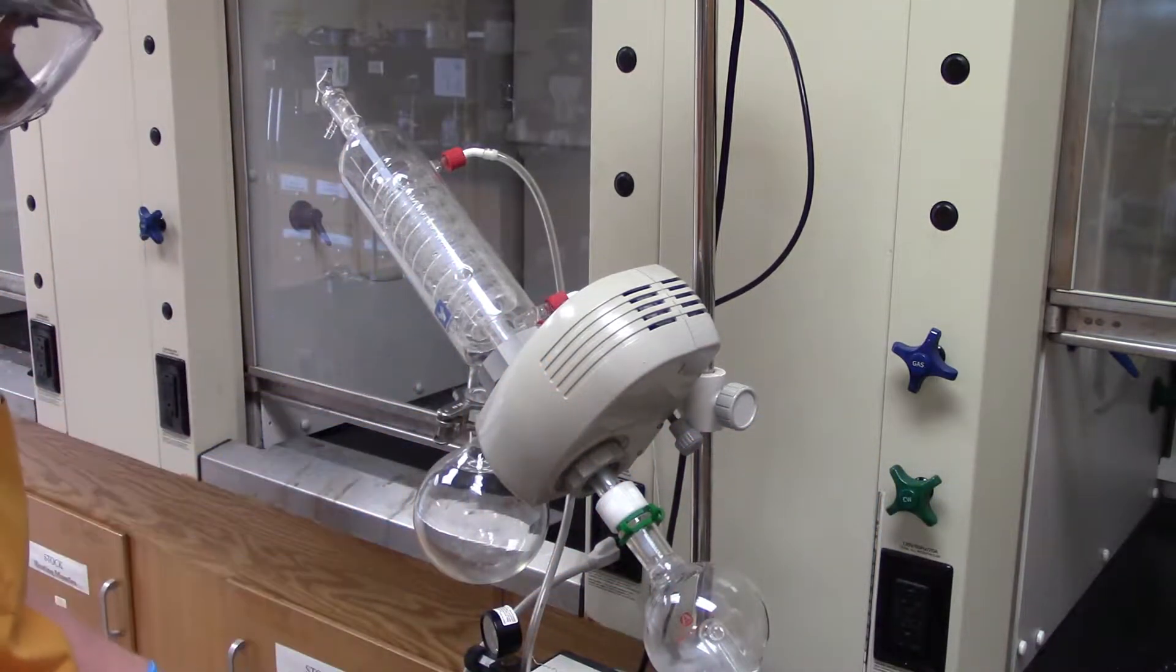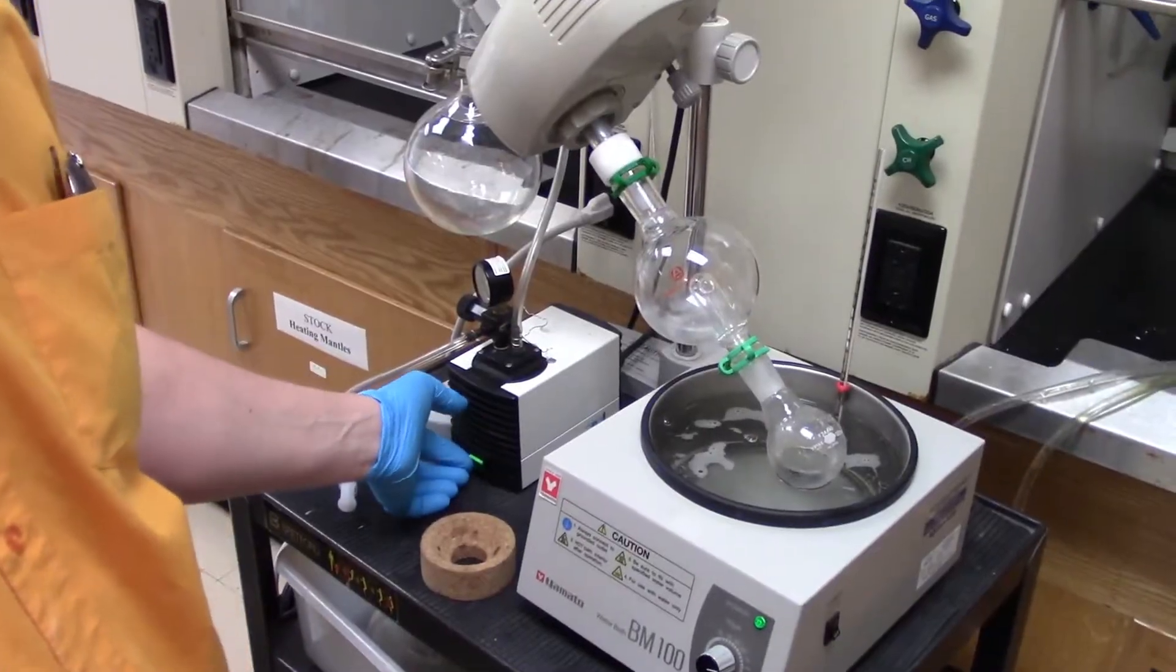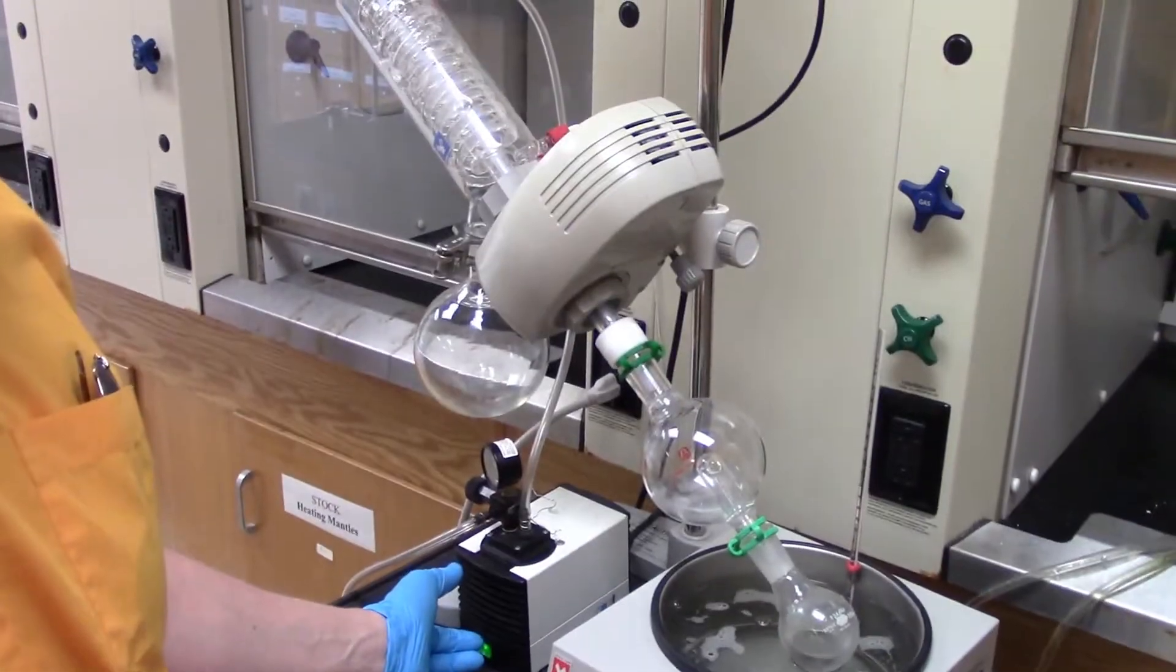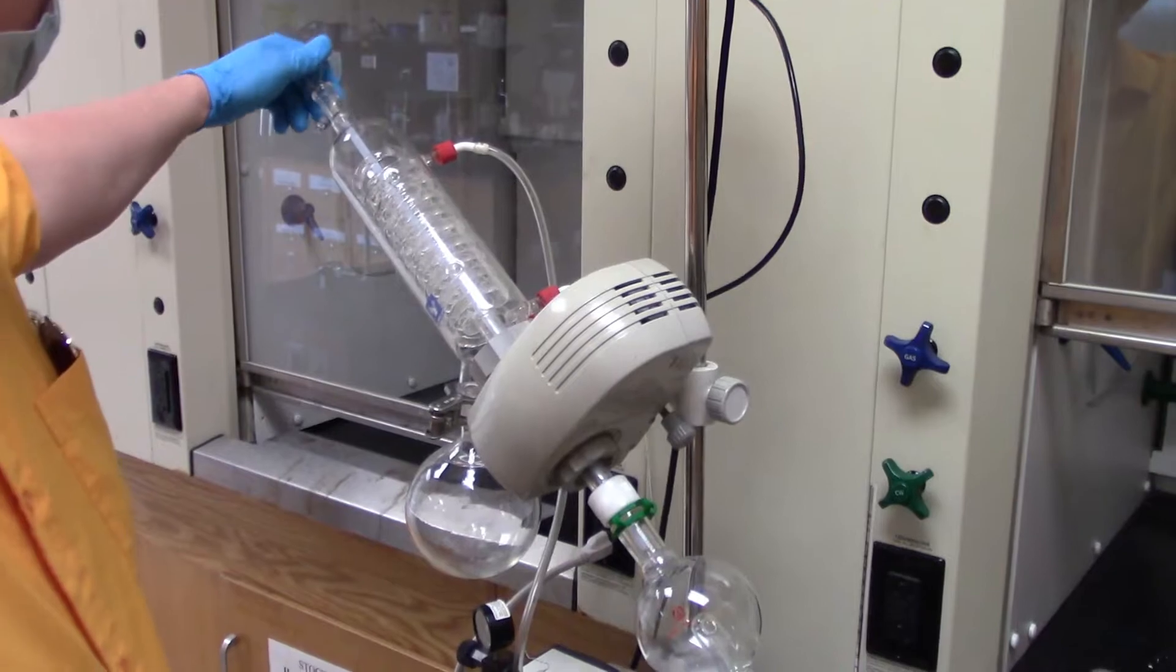You can see it running through the coils. Down here, I'm going to turn the pump on first.